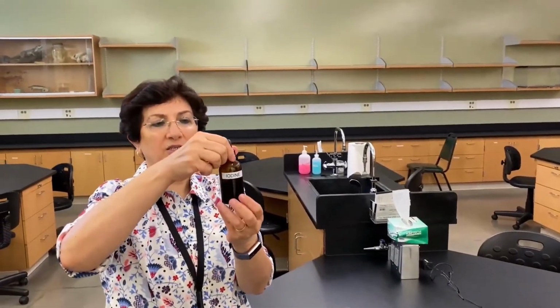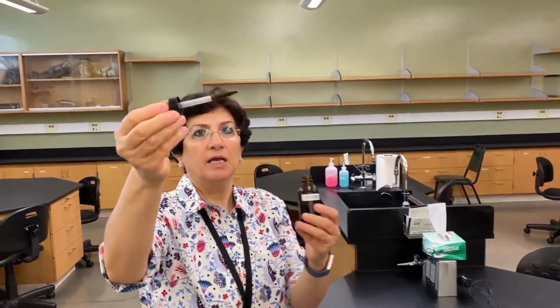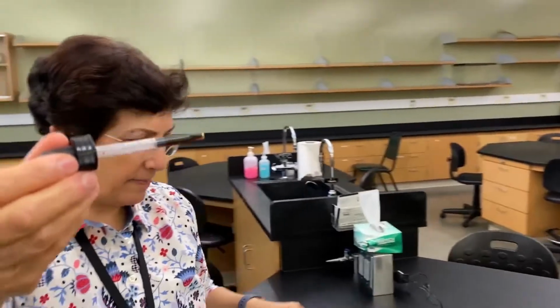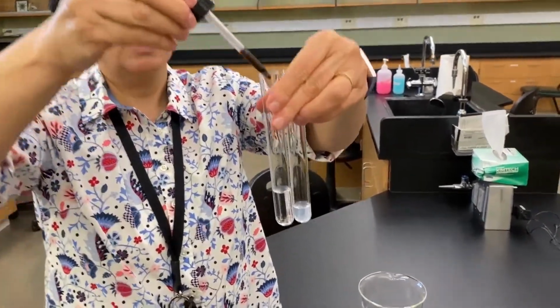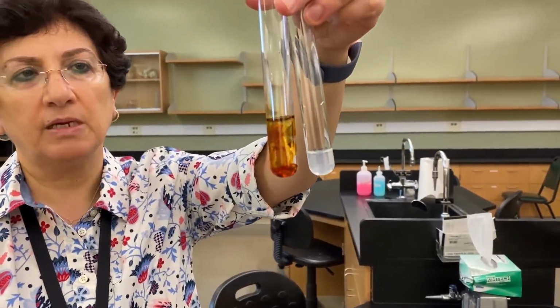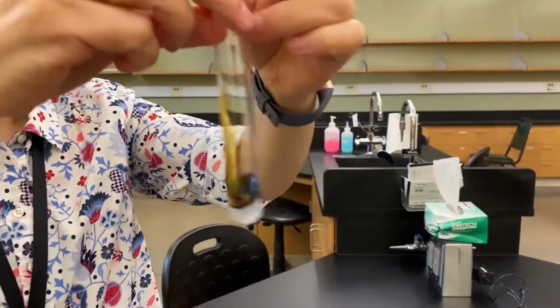Okay, test for starch, we use iodine. And again, iodine has this brownish amber color. And we're going to see if there is starch in the solution, what happens to this color. So I'm going to take my 2 starch, or the tubes I'm testing for starch. This is the one, the outside, meaning the water from the beaker. And we're going to compare them in just a second. This is the inside, and I'm adding again a couple of drops of iodine. And let's see.